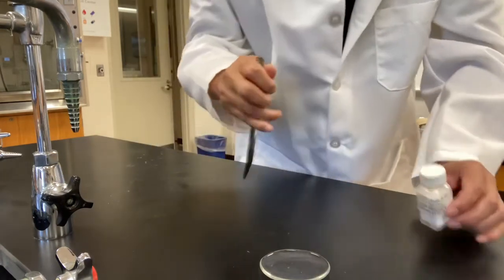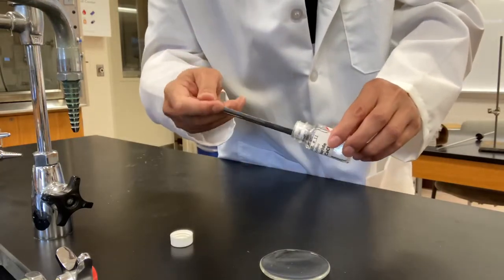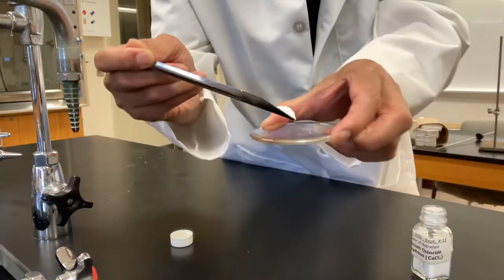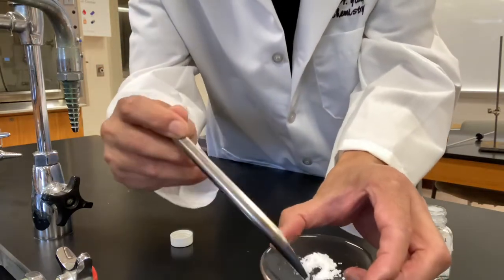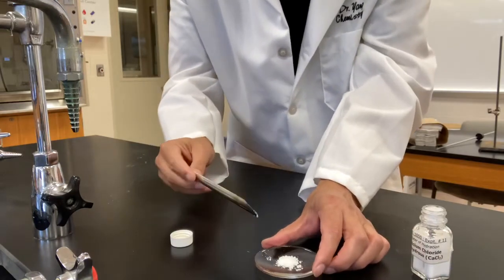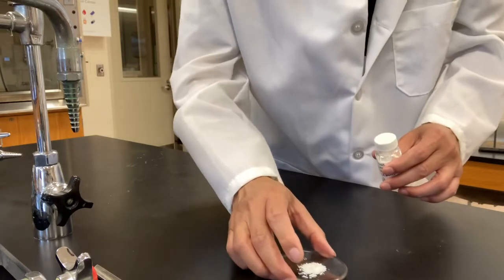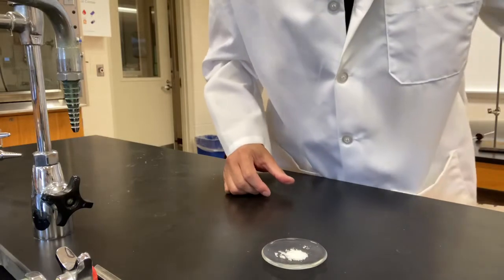Okay, so I'm gonna take some sample out. Okay, so white powder. When I shake it, I don't know if you can see it, the white powder can flow freely. So the initial state of this calcium chloride sample, it looks like there are white powders that can flow freely. Okay, we'll leave it here. We're going to talk about the second part of the experiment.